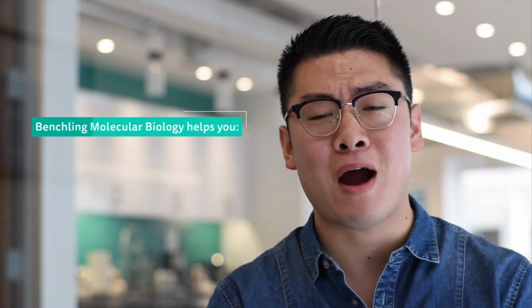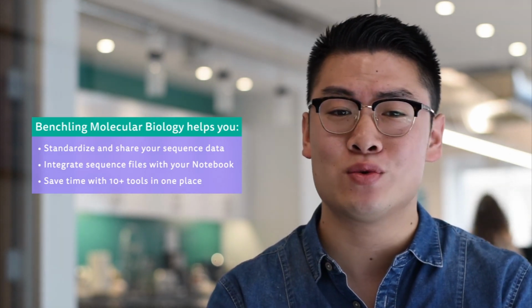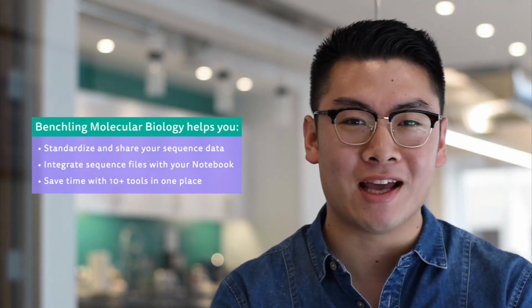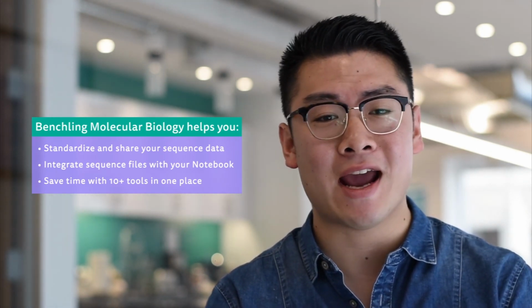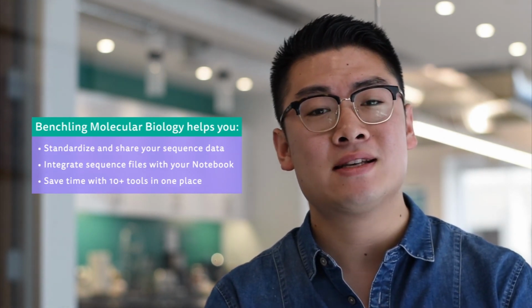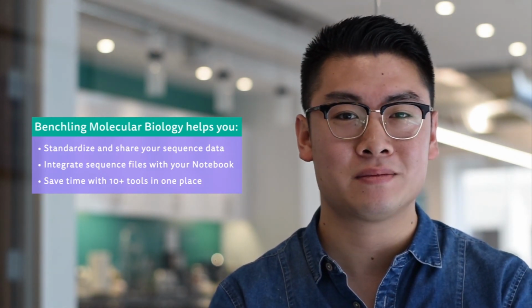Molecular biology is a powerful application with over 10 sequence design and analysis tools that are user-friendly and highly customizable. It will allow your company to standardize and collaborate on sequence data, saving you time and allowing you to carefully manage your data from day one.